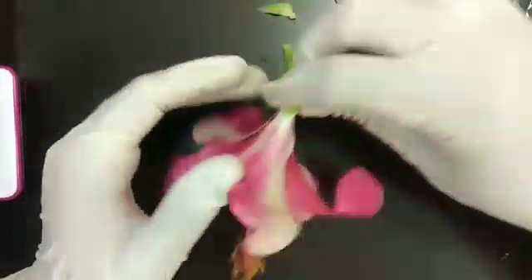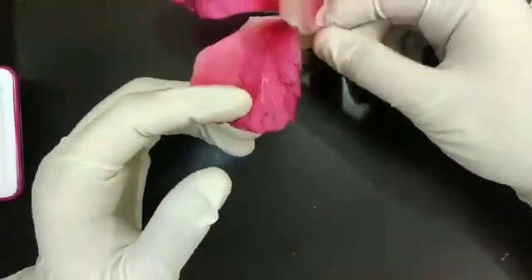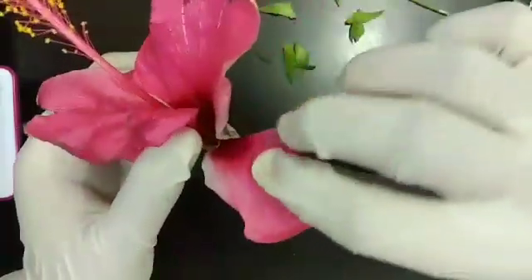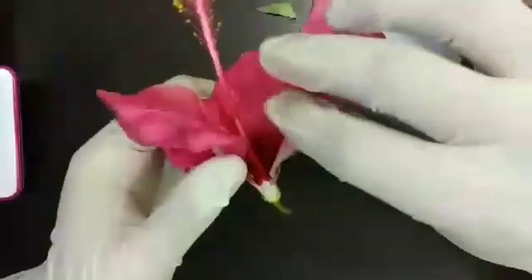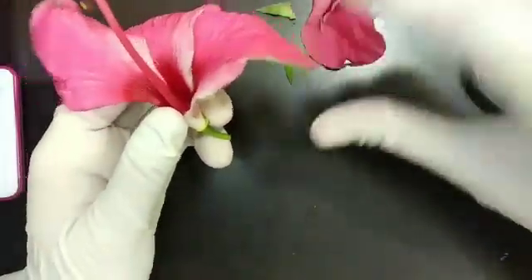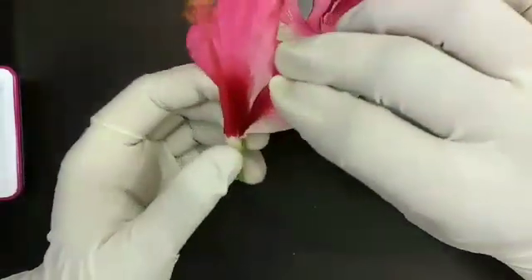Now, after when you are done with this part, you are going to remove the petals, which is the colored part of the flower. Be very careful and slow.